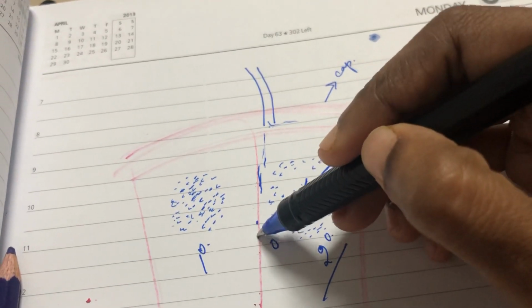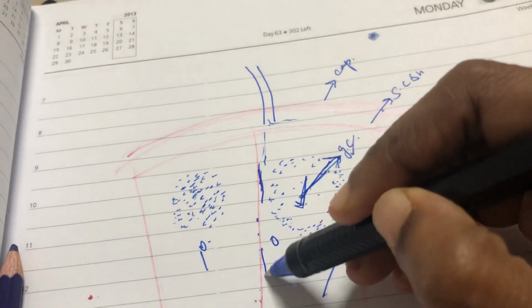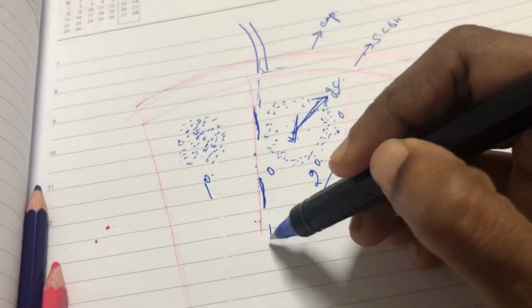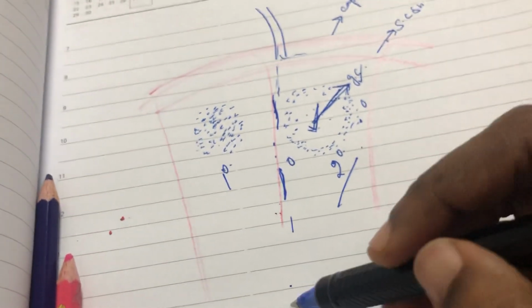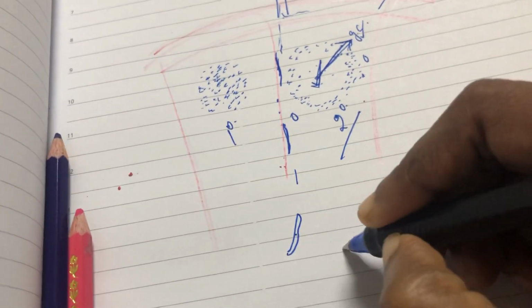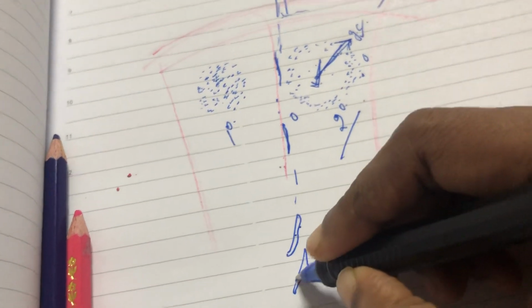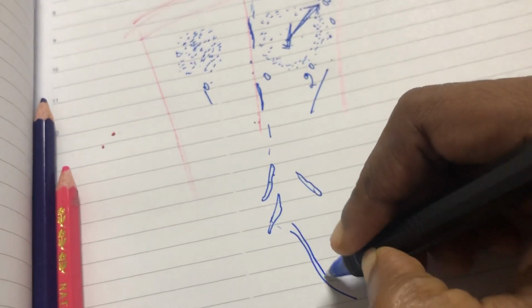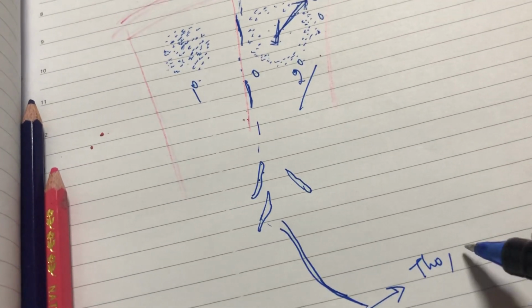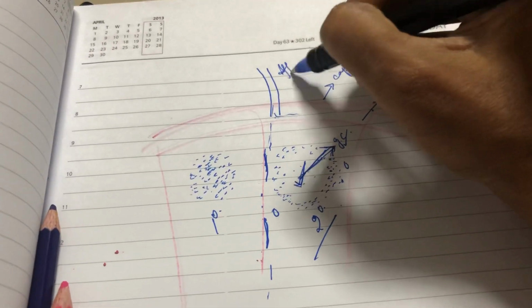Blood vessels and nerves pass through the trabeculae, and at the side of the trabeculae you have sinuses called trabecular sinuses. The lymph enters the trabecular sinuses and then comes down into the medulla. In the medulla you have another sinus called the medullary sinuses. From the medullary sinuses, through the efferent ducts, it goes out and drains either into the thoracic duct on the left side or the right lymphatic duct on the right side. This is how it goes. So this is afferent and this is efferent.